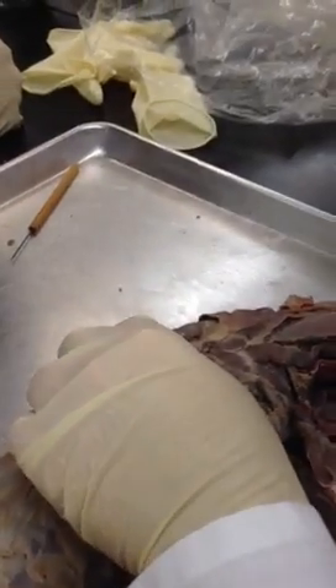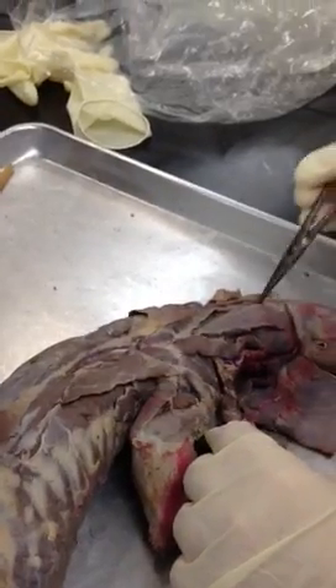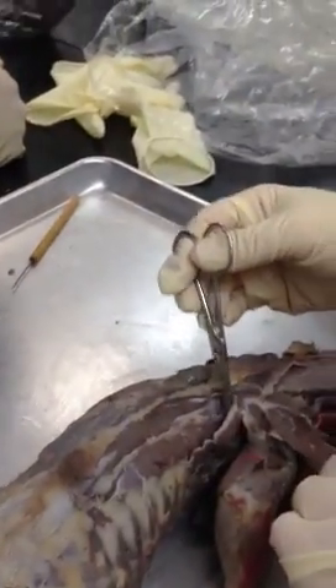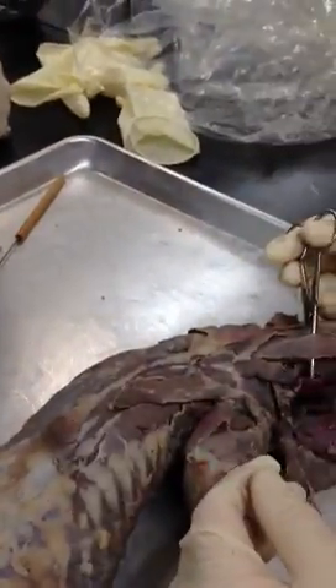Can you see longissimus from there? No, you really can't — it's deep. What about the splenius? Splenius capitis is right here. But the splenius is also right by serratus ventralis — it goes down here a little bit deeper. On this mink, I don't want to go deeper because it'll be different from my 220 lab.